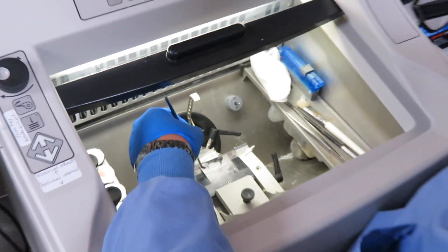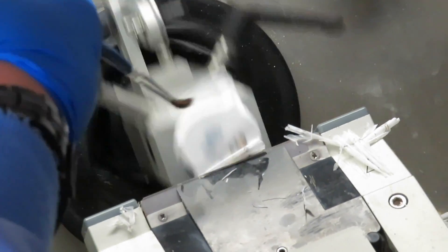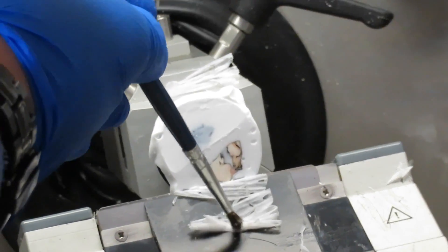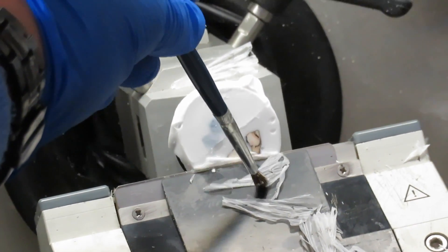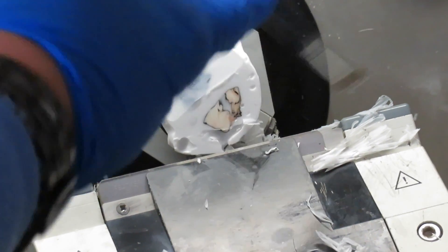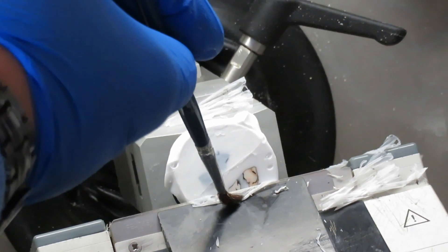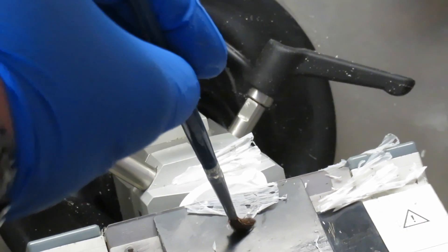There's one face section coming in, but it's not a full face section yet. There's a bubble that's preventing full access. We need to bring the tissue closer together. Maybe next time we need to let the platform surface settle. There we go — that's a good one, as best as we're going to get it.